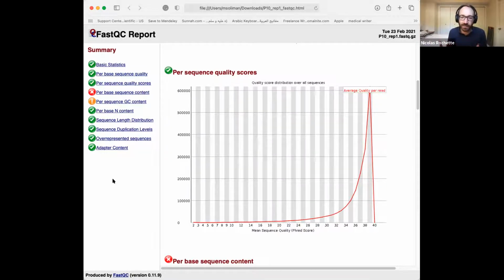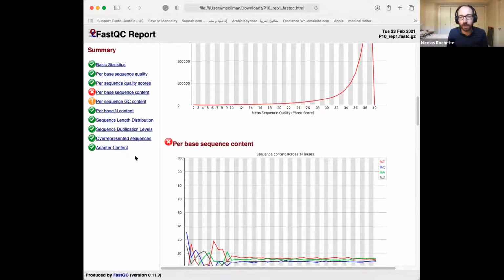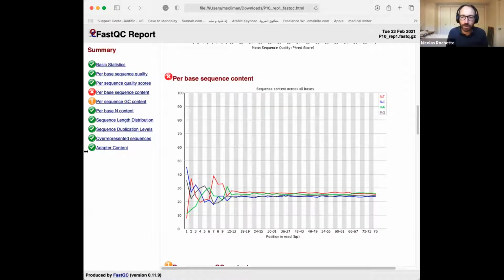But very often we start seeing things in the FastQC report where we think, this sample might be a bit different from the others. And then the further we progress into the analysis, the more we realize that yes, something was wrong with this sample. The fact that it was already looking wrong at the read level, the raw data level, really suggests that there is a technical artifact. Also, if there are really big technical artifacts, like the sequencing not working, and pray that's not going to happen with modern Illumina sequencing, then we see it right away.